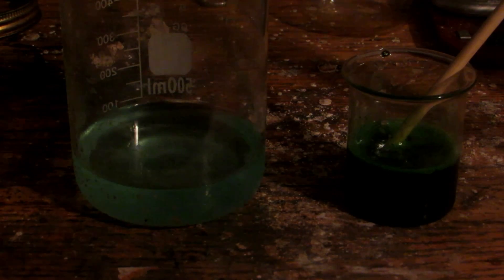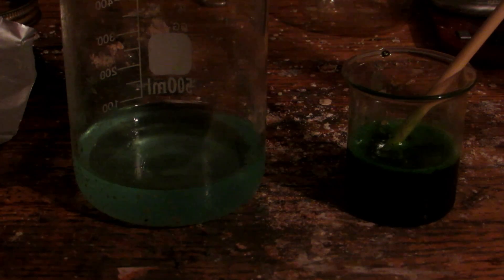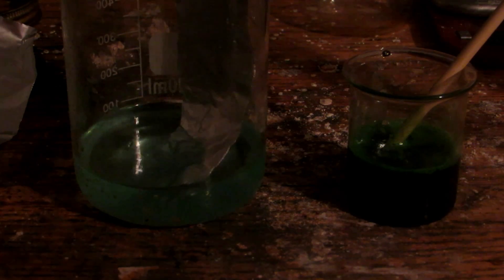Upon adding a more reactive metal such as aluminum or steel — which is why you never stir this with a steel object — it will actually start reacting to form copper metal. This is a simple displacement reaction where copper chloride reacts with aluminum foil to produce copper metal and aluminum chloride. The dilute solution might not show much, but with a very concentrated solution a very interesting reaction occurs. I just have a wooden chopstick as my stir rod, and putting a bit of the concentrated solution on some aluminum foil, you can see a very vigorous reaction happening. Large amounts of copper metal are forming on the aluminum foil, and the concentrated solution generates a lot of heat. That's one of my favorite reactions to do with this.